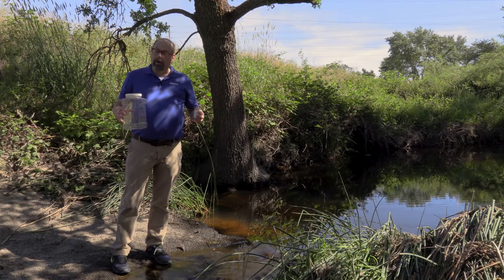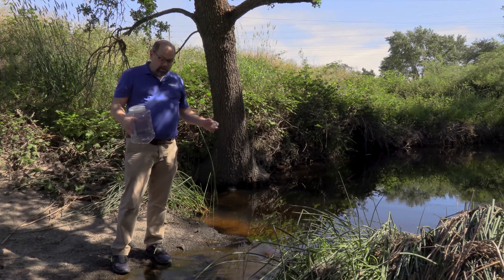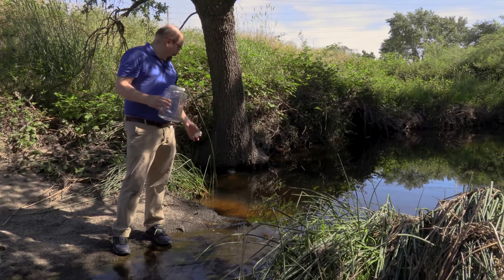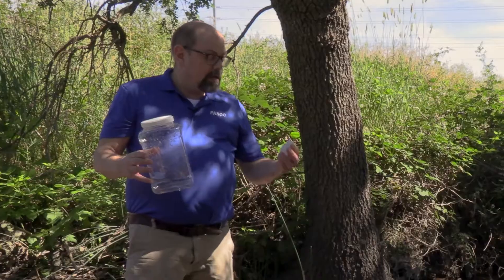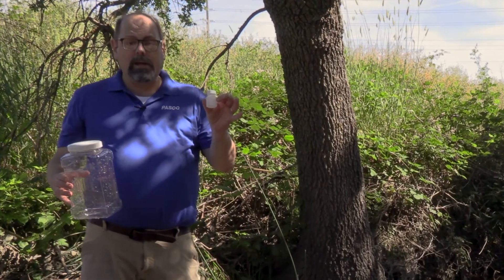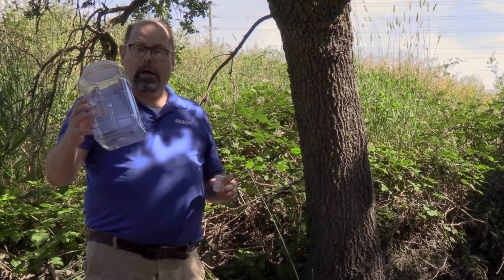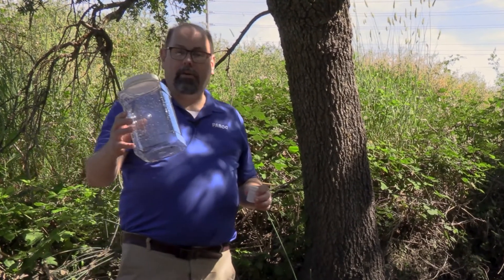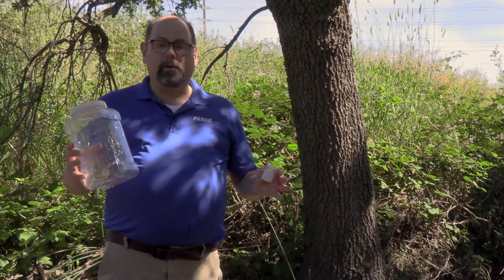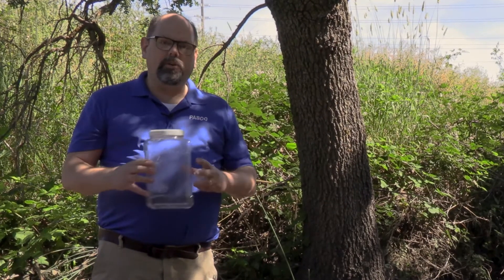First thing when we go out into a water quality study is to find a place that's safe. You'll see that this is a great example of shallow water with easy access to gathering samples. Sample bottles can be taken both in small quantities if you're just doing a few tests, especially with non-destructive methods like using probeware, or if you're going to use a lot to test chemically, then we're going to grab larger samples to bring back.